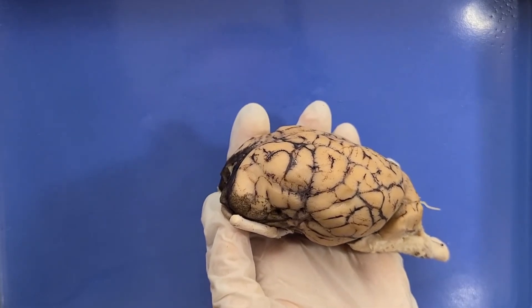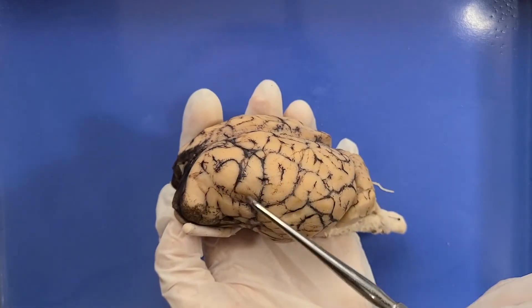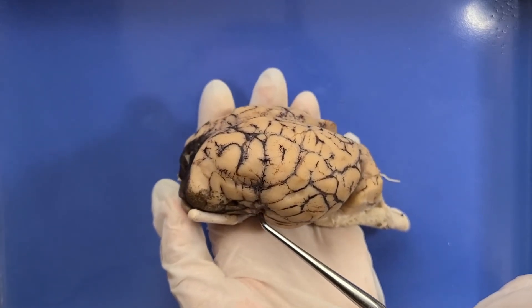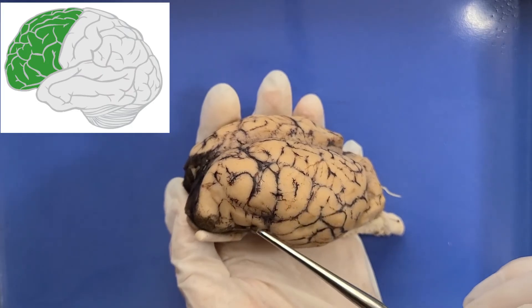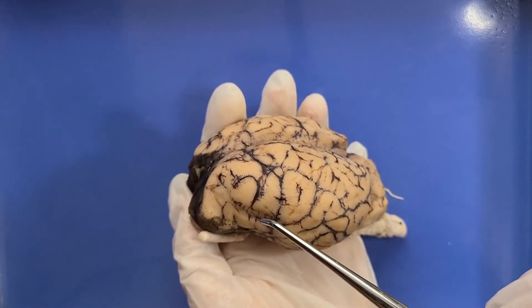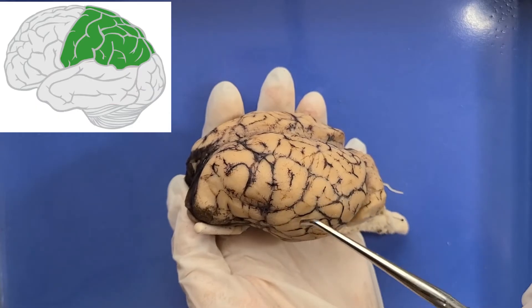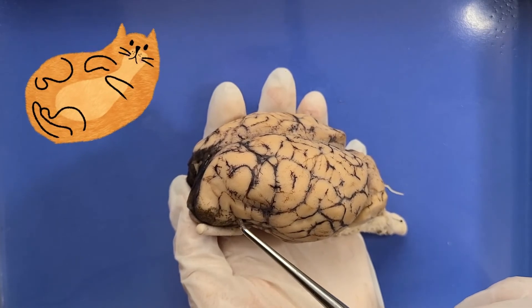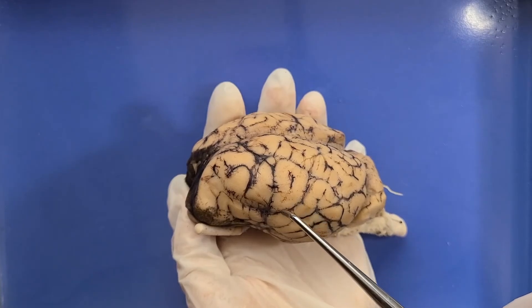To distinguish the frontal lobe from the parietal lobe, we look for the central sulcus, which runs all the way from the midline and separates the frontal lobe from the parietal lobe. The frontal lobe is involved in motor control and higher-order functioning, including consciousness, communication, judgment, and learning. The parietal lobe processes sensory information from the outside world, mainly relating to touch, taste, and temperature. So if I decide to pet a cat, that decision gets made in the frontal lobe, which also moves my arm to touch the cat. Then the sensory information — the cat is soft — gets sent to the parietal lobe for processing.